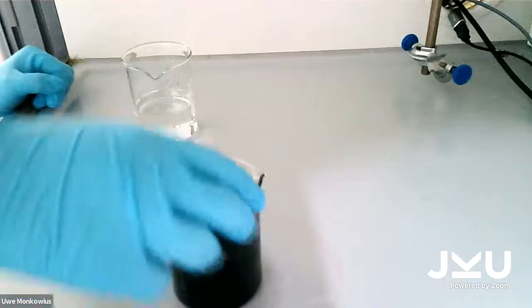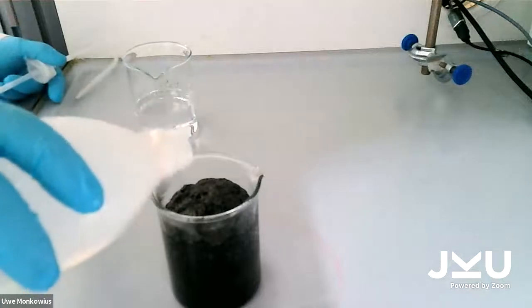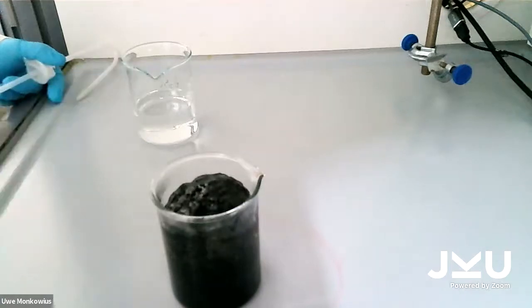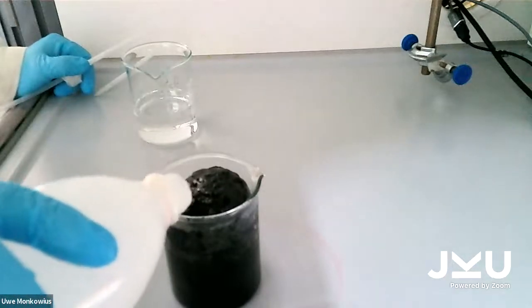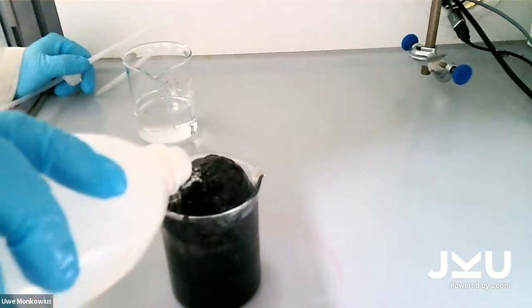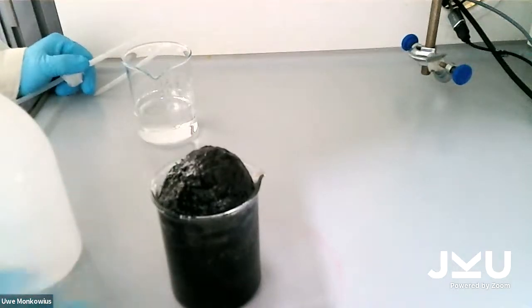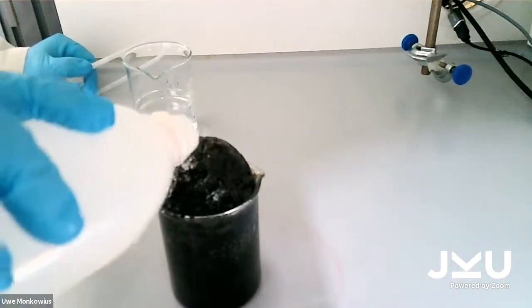And now I'm gonna add some water to it to cool it down a bit. Hopefully cool it down. Yeah, no, that didn't do anything. It's still boiling. But I want to show you the black mass, so I'll pour in more water. You can see that there's a gas inside because it floats on the water. It's almost like black bread, but no, please don't eat it.